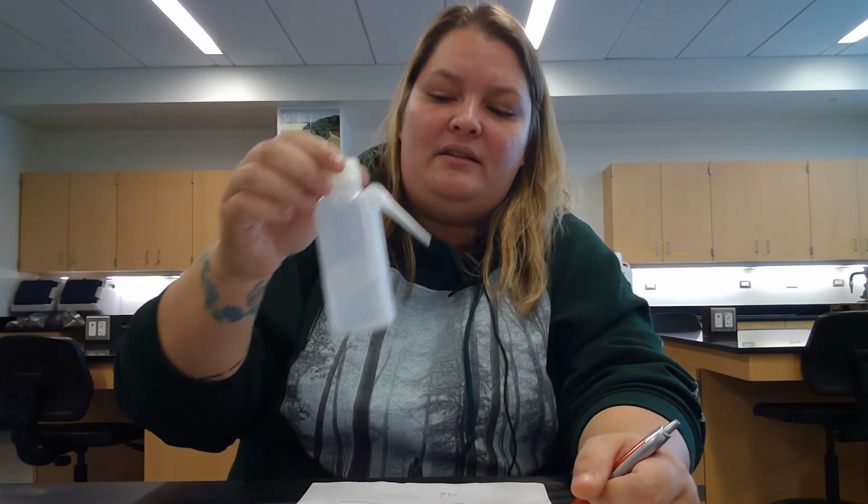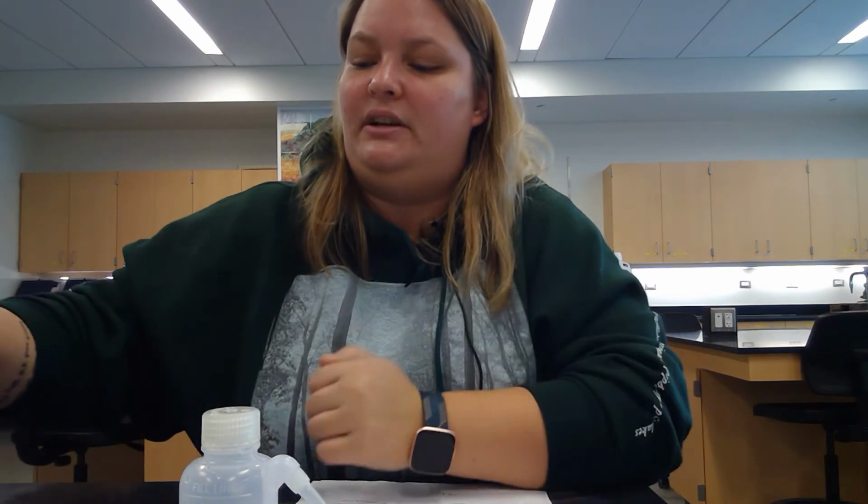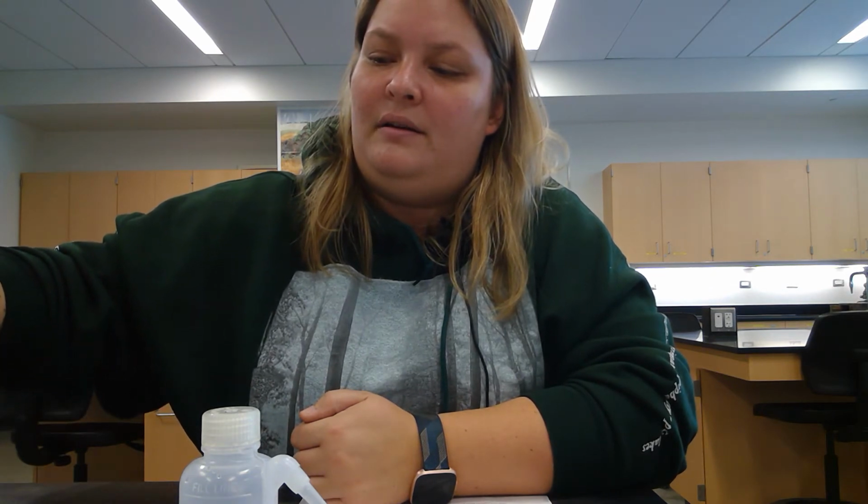I put my crucible back on the scale, and now as you can see in the lab report, we are going to determine the volume of the crucible by filling it full with water. Then we're going to use the wash bottle to add in a few drops to get it up to the top. And we can confirm our statement by pouring the water from the crucible into a graduated cylinder and double checking that. All right, so I'm pouring.